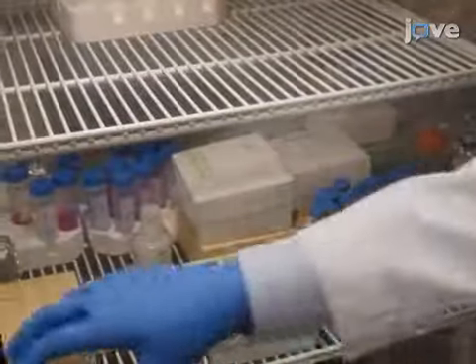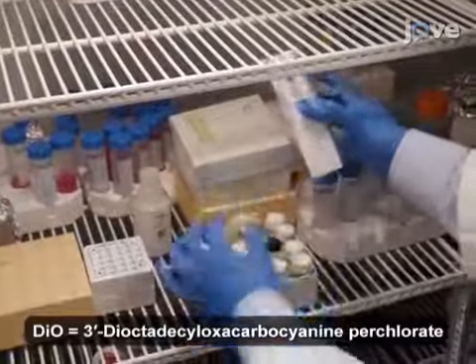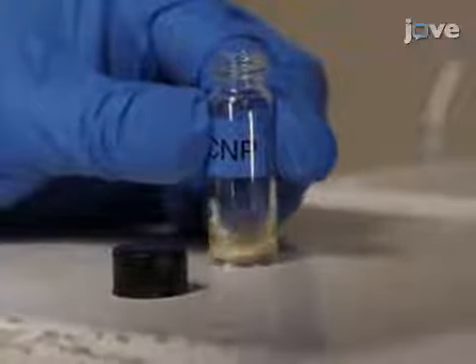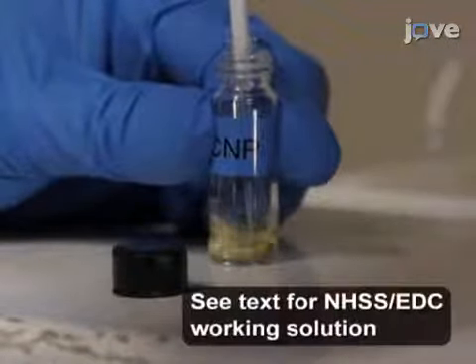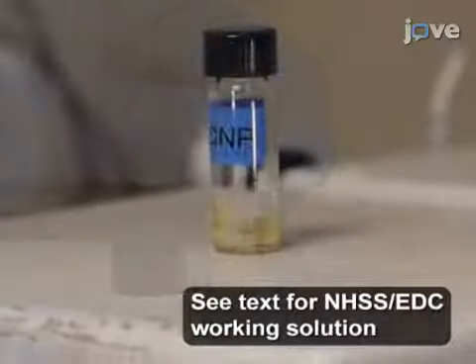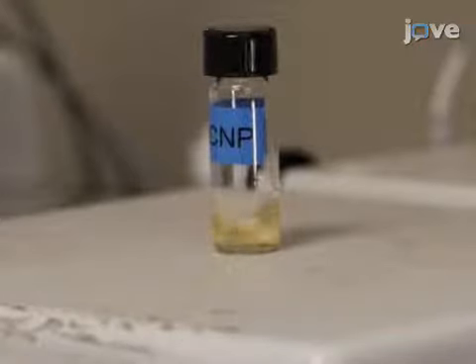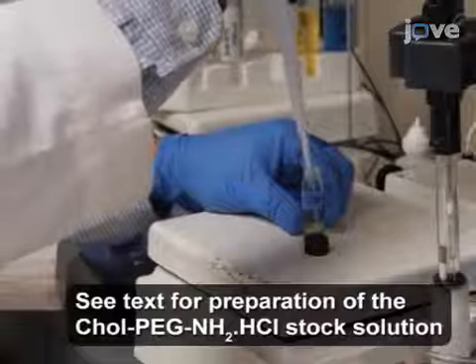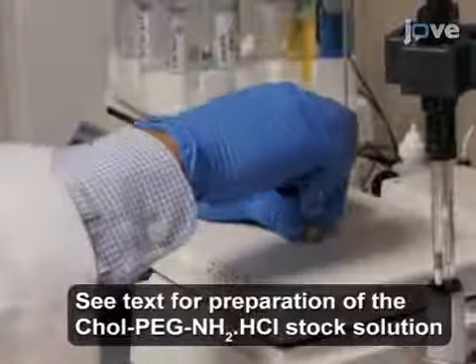Begin this procedure with preparation of DIO liquid crystal nanoparticle as described in the text protocol. Then add 20 microliters of freshly prepared working solution of NHSS-EDC to 1.0 milliliters of the DIO liquid crystal nanoparticle in HEPES buffer and stir for 5 minutes. Next, add 20 microliters of a stock solution of cholesterol PEG-amine to this mixture and stir for 2 hours.